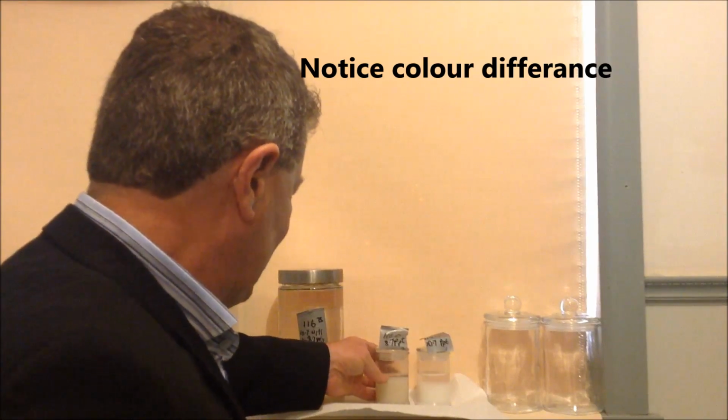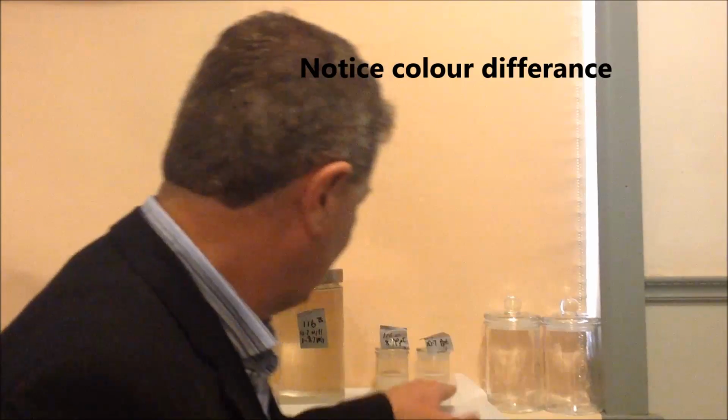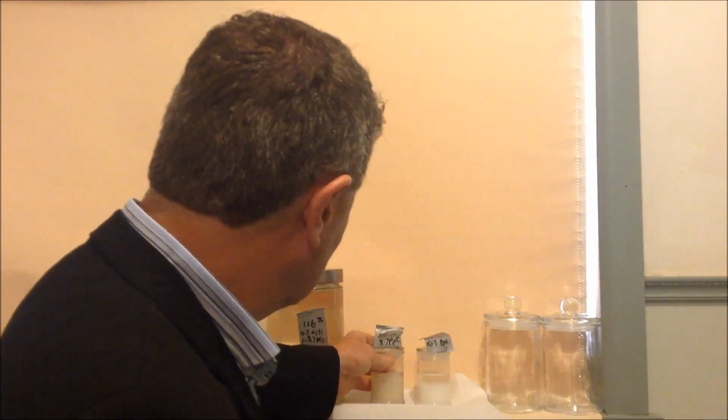Now, first differences, you'll notice there's a slightly different colour. That's normal. The first precipitate's normally very white, and this one's more of a tan colour, although upon powdering and annealing it does tend to lighten up, but that's for later experiments for you guys.